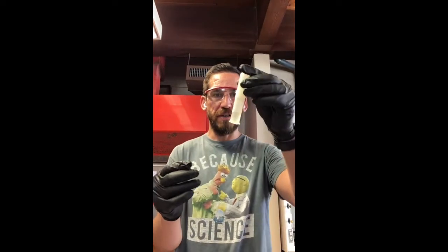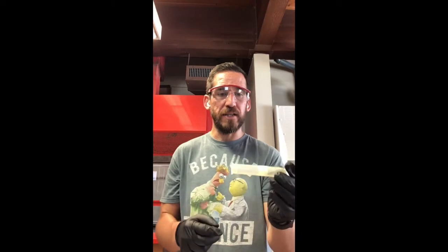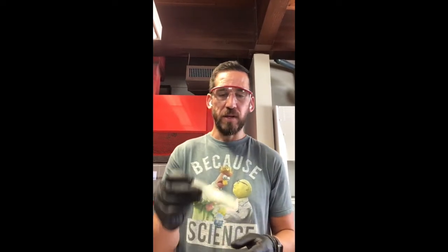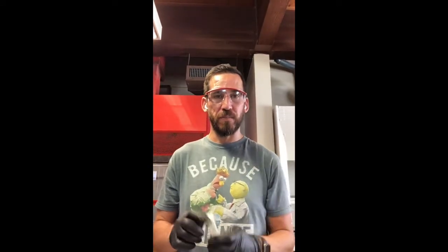So it's better to see if it leaks with water than to just use it and then find out later that it leaks and have methylene chloride leaking, because methylene chloride is really volatile. It's carcinogenic, and it's a mutagen, so it's just a nasty substance that we don't really want pouring out of the centrifuge tube. And this one seems to be working pretty well, so that's awesome.